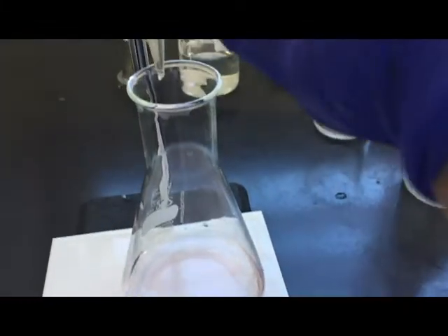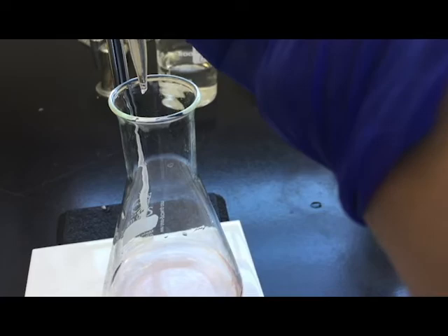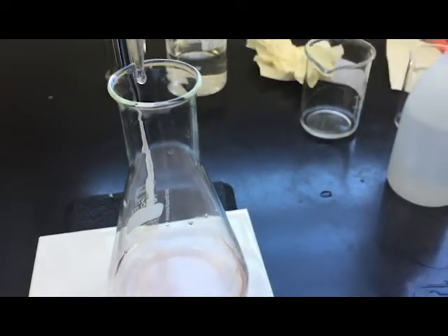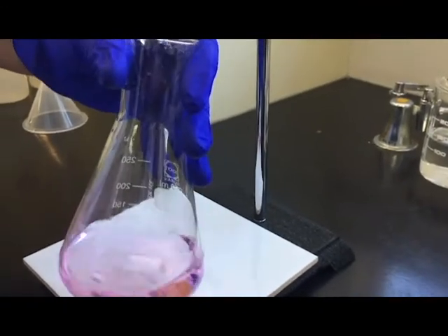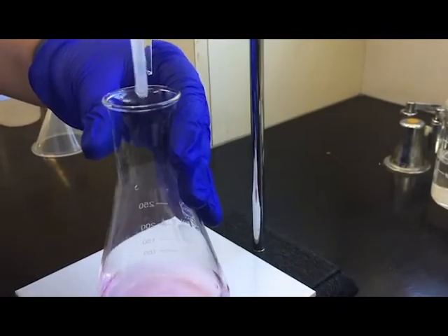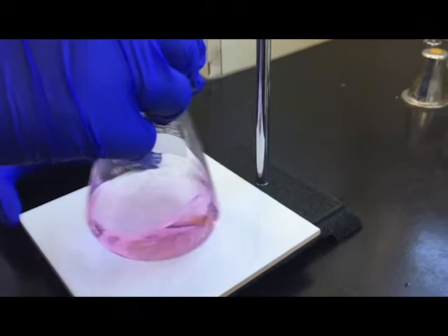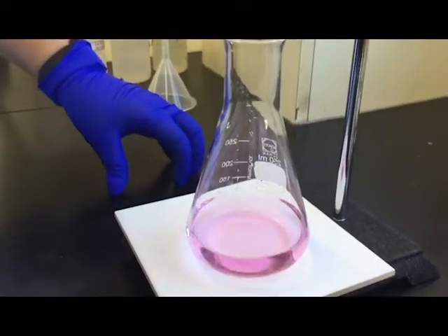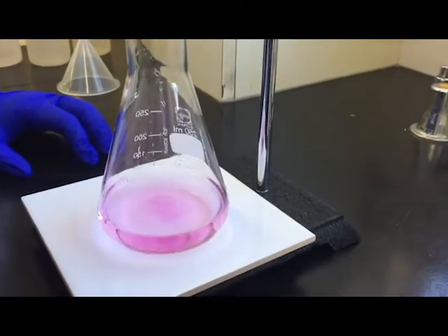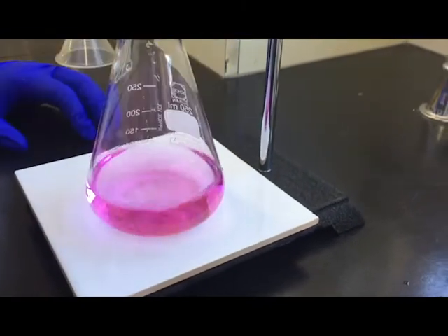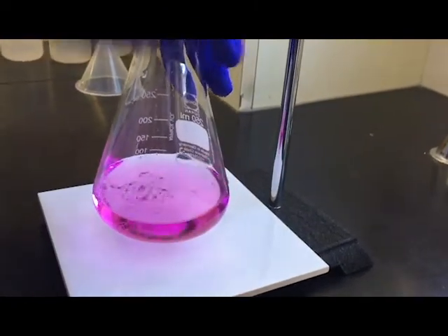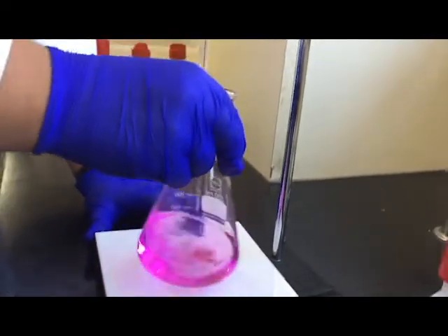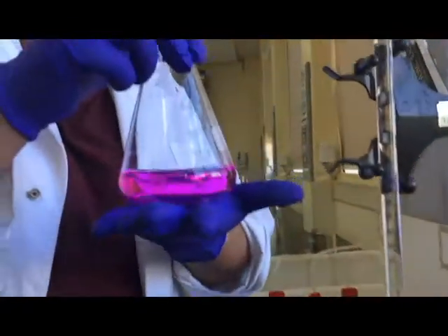And just to show the difference, I'm gonna put in one more drop. Oh, that was two drops, that's all right. But already you can see now it's a lot more distinct pink. That's not that it's too much pink, but it's pinker than what we'd like, whereas that first time when I stopped it, it was a nice really pale pink. And just for fun, let's put some more in. Yeah, so now we're getting really pink. Stuff like this is definitely too far. And trying to get it really bright pink... that's what we definitely do not want.